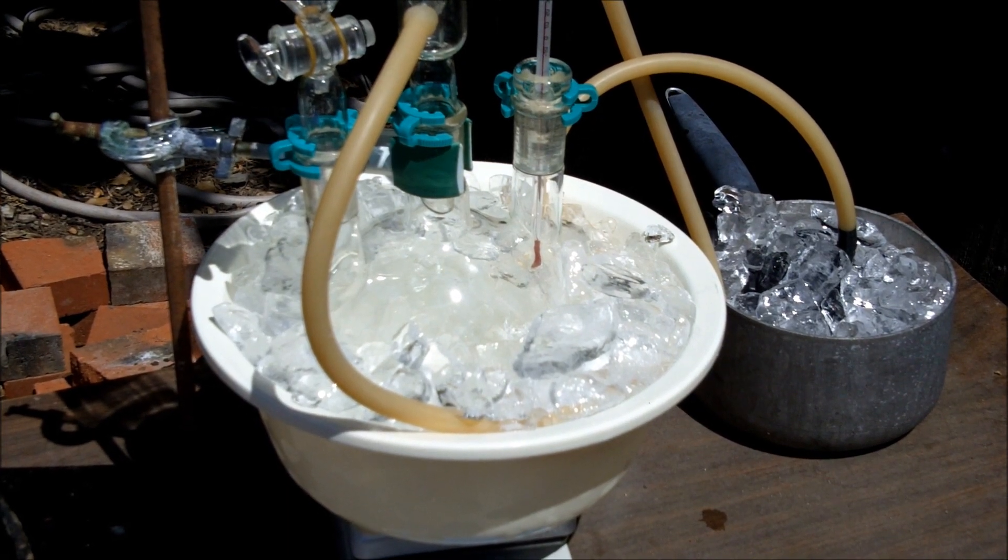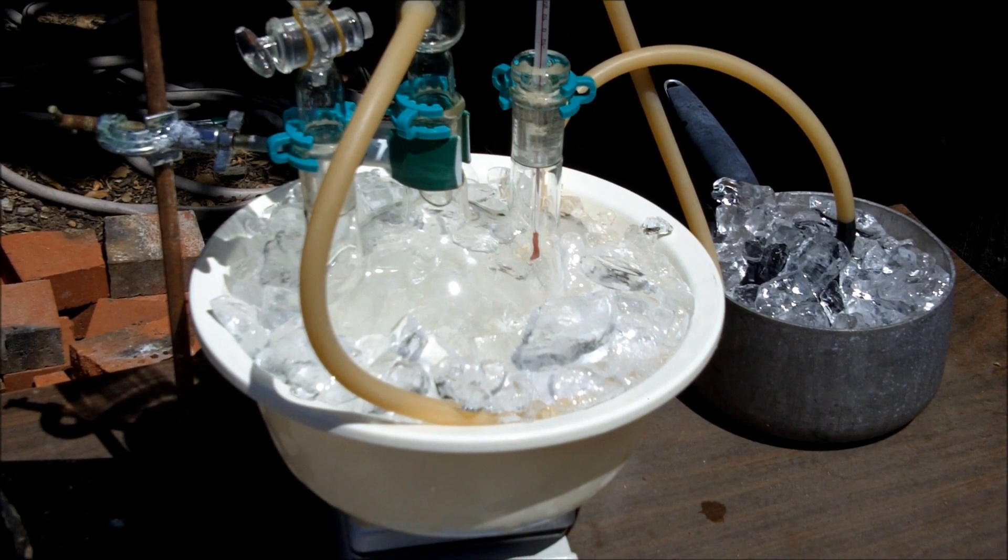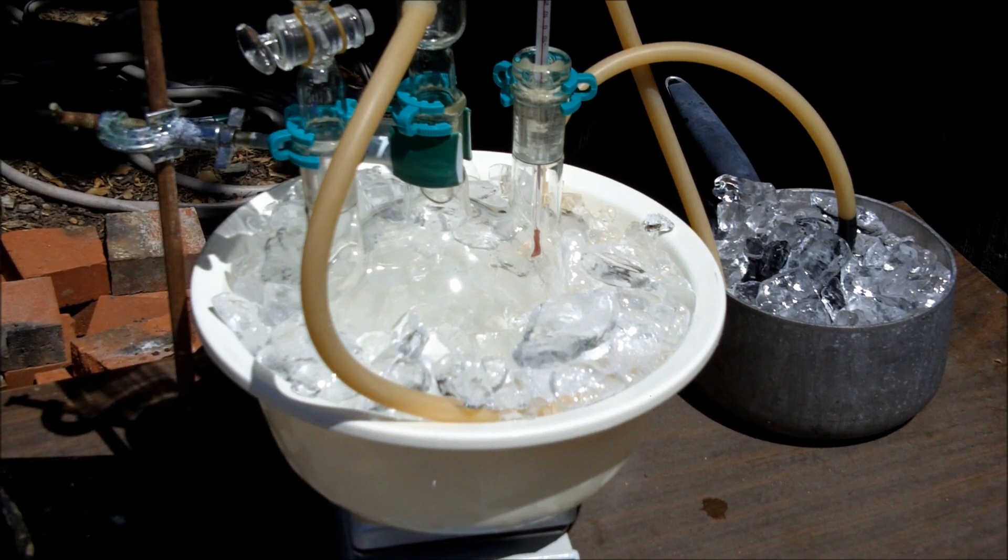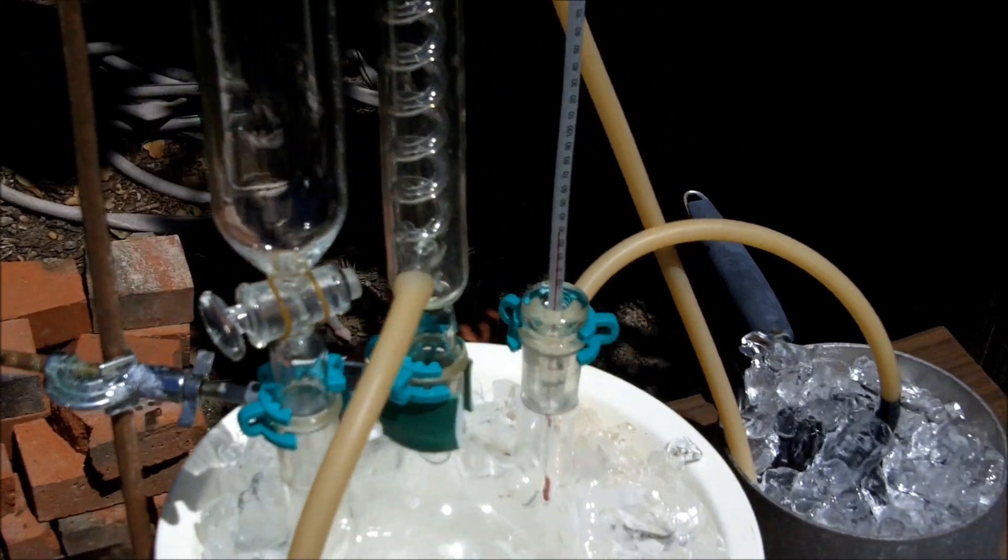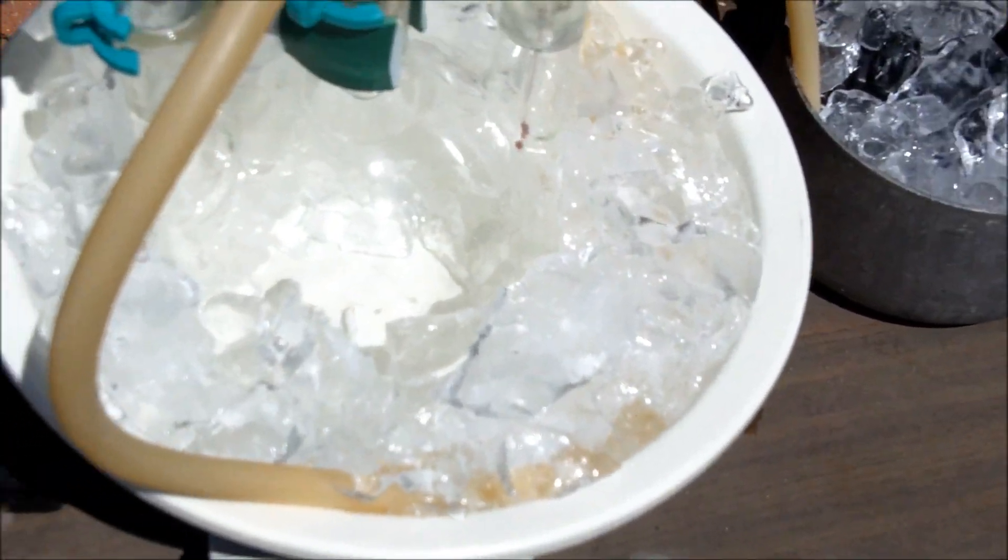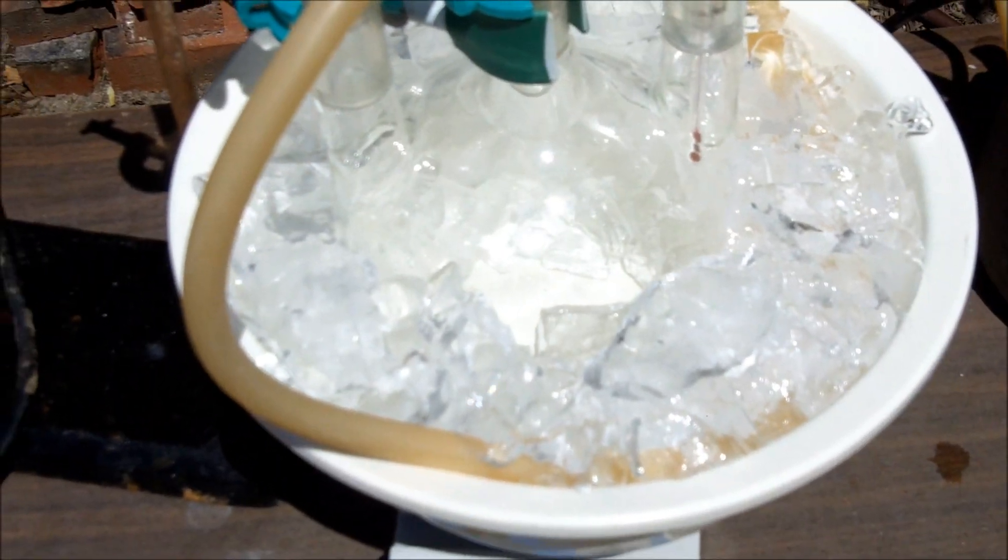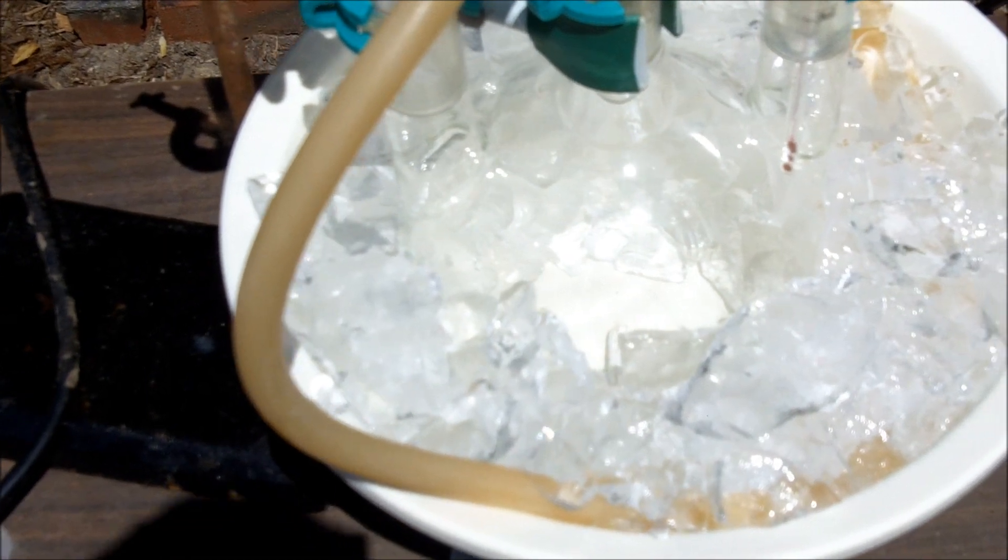Hey everyone, in this video I'm making chloroform. I figured since my last video was on iodoform, I should show how to make chloroform. In this bowl here I've got a three-neck one-liter round bottom flask, and it's surrounded by ice.